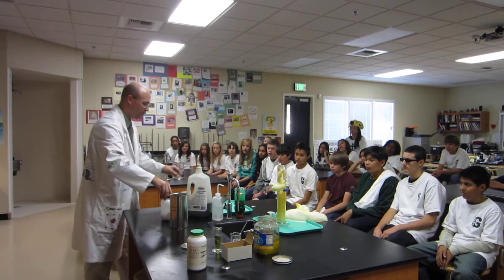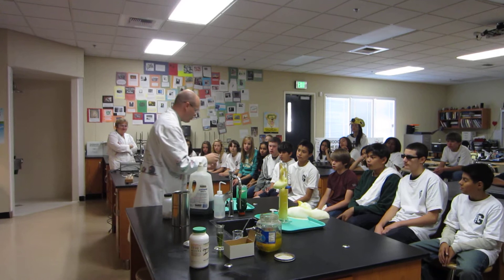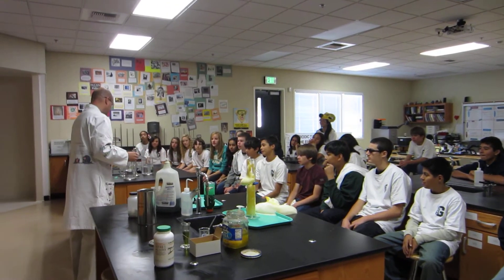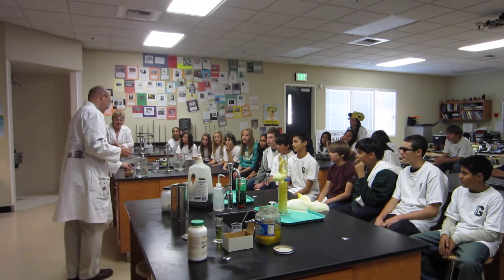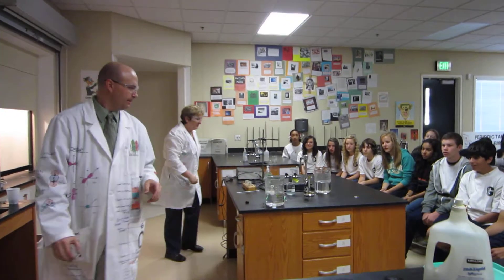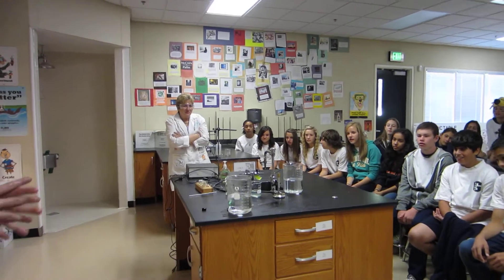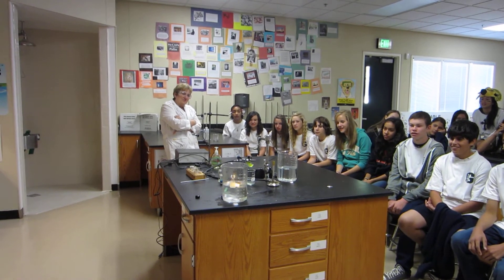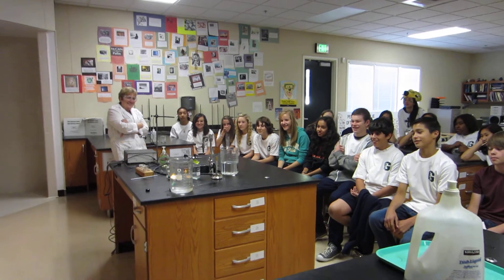Now I keep it under oil. You can see it's really shiny there, isn't it? This guy's about to be in the front. It just sizzles. We're learning about it. A metal and water? Be ready for it — it gets more exciting. It's going to be a lot more exciting for a couple of you. Boom!